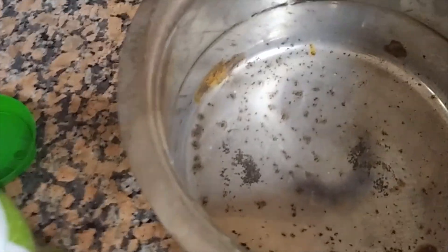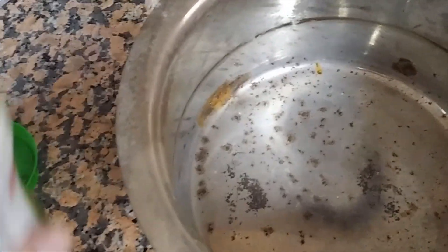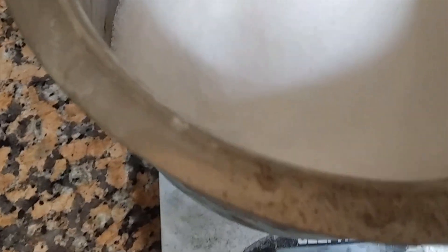So you probably already know why you're here. We're here to separate potassium chloride from sodium chloride. Unlike other methods, our aim is to get all of it, or most of it. We're weighing how much diet salt we have — about 617 grams, call it around 600 grams. I'm using this pot because we don't really need any beakers for this; this is food-grade chemistry. I'm using this as a water bath. So all we really have to do is boil this solution and then stick it in the freezer.